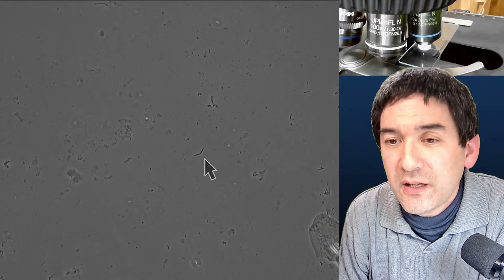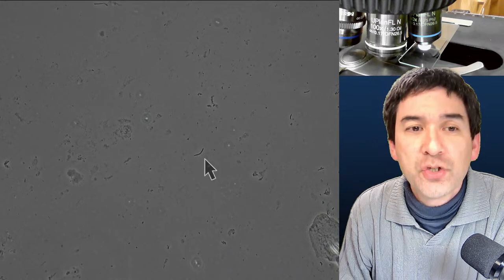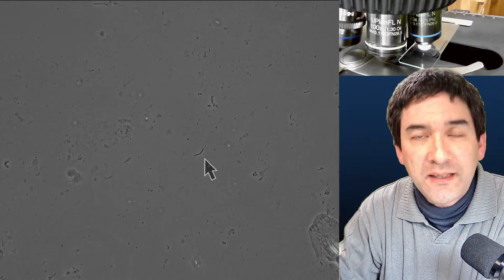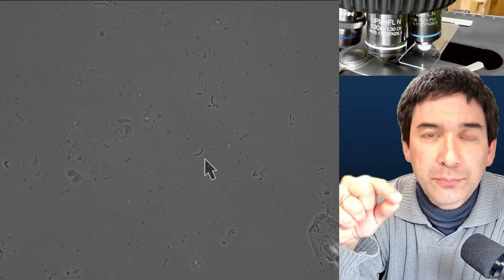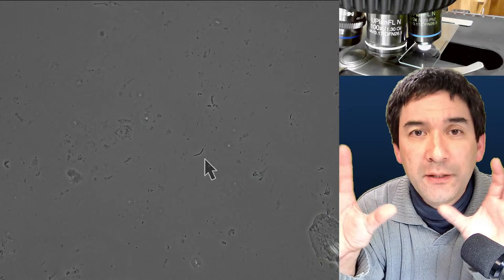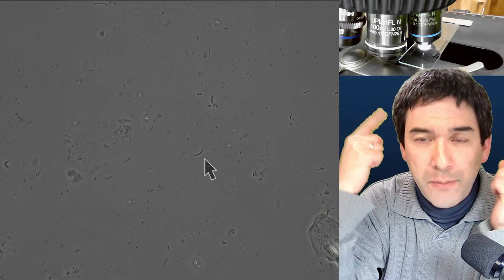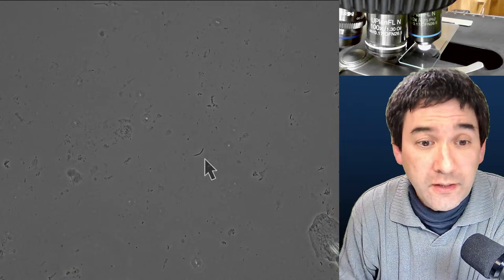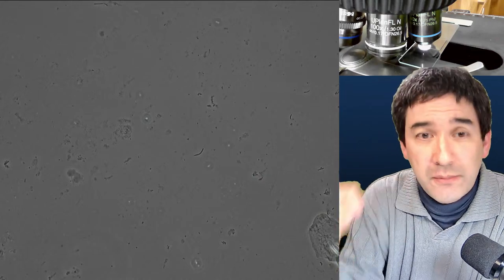Regarding camera software and OBS Studio: what you see on screen is exactly what I see through the microscope. I capture the video from the camera and feed it into OBS Studio — a free program — which combines multiple cameras including my face camera, green screen background removal, the microscope image on the side, and a graphic arrow overlay I can toggle on and off.